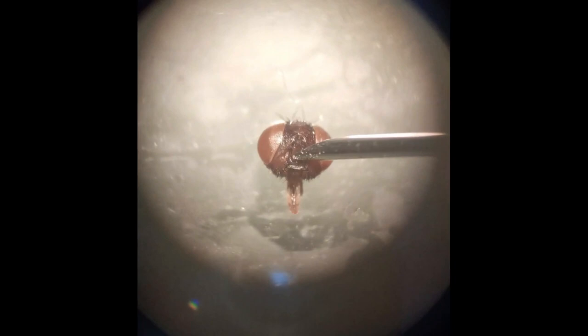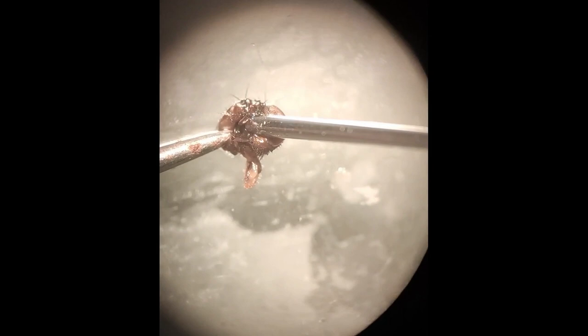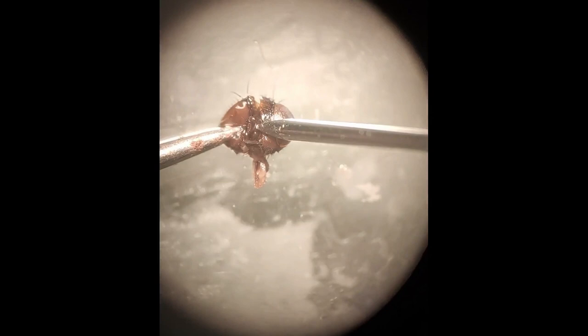Please try to locate those. Now I am trying to dissect the aristate antennae. With the help of the left needle, I am pressing the compound eye portion.